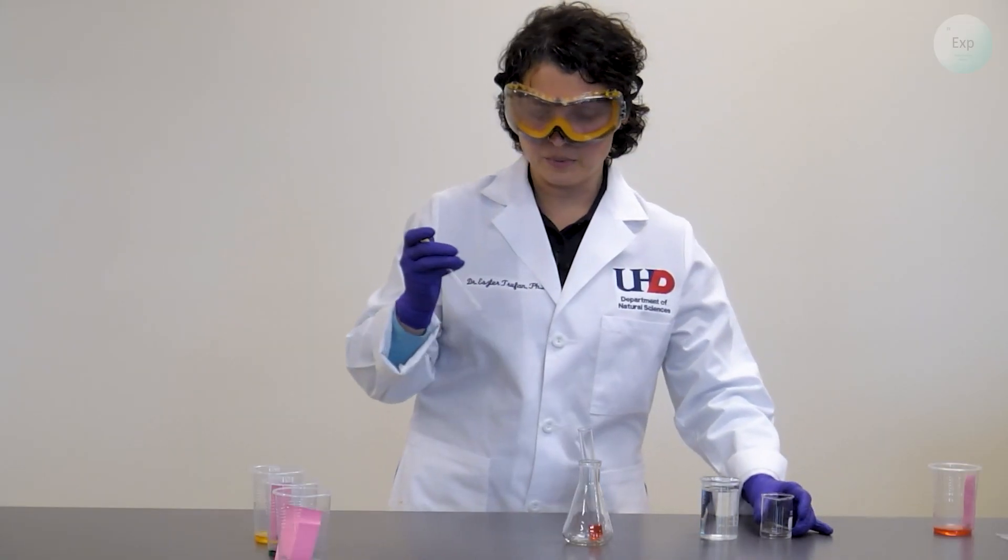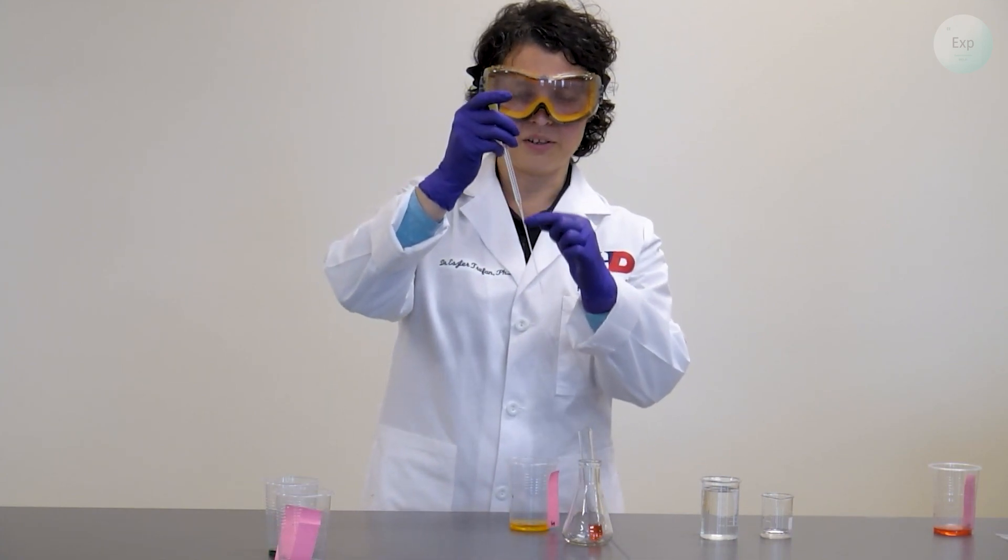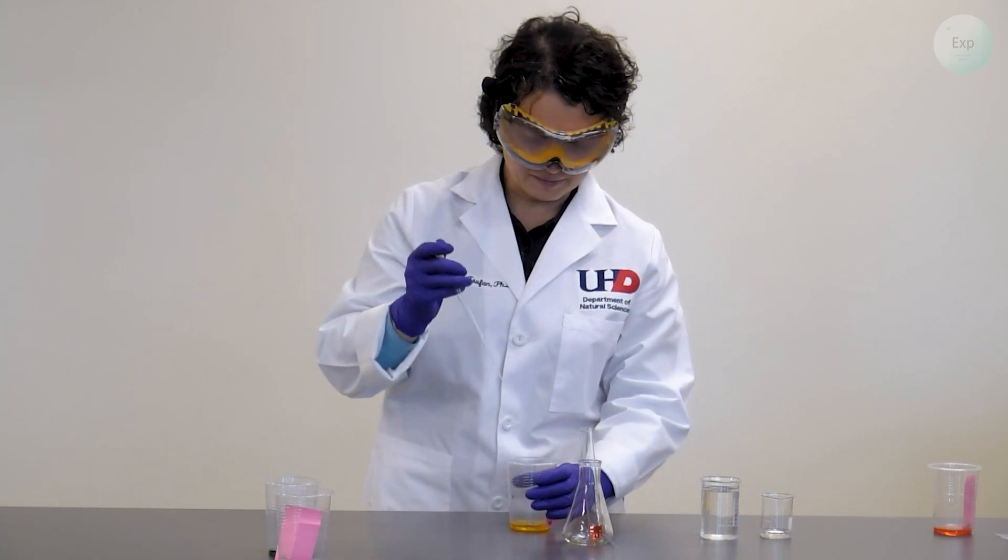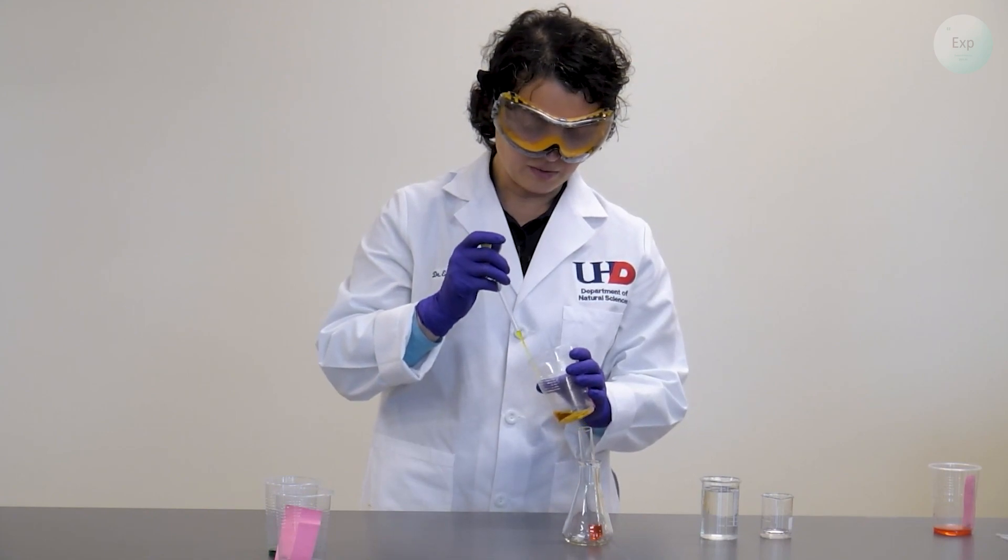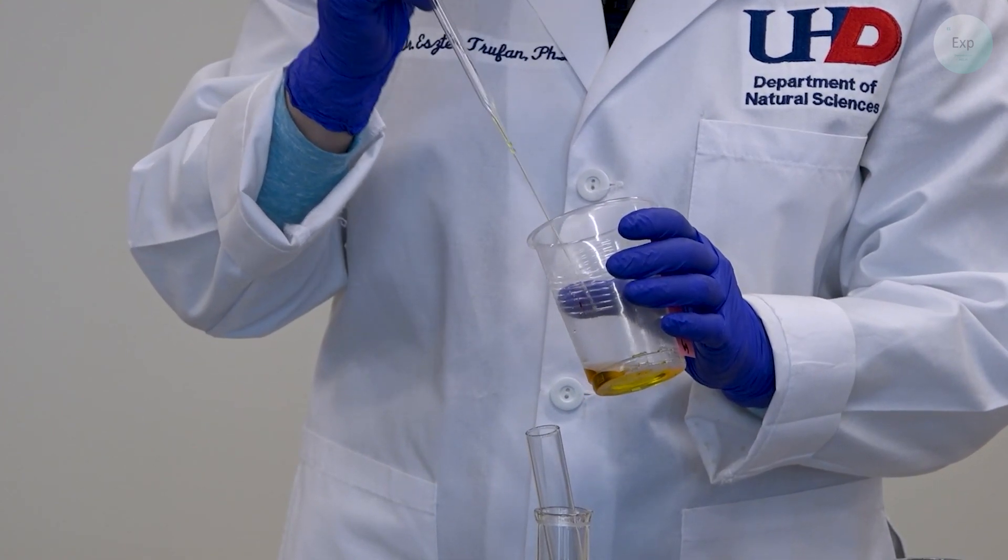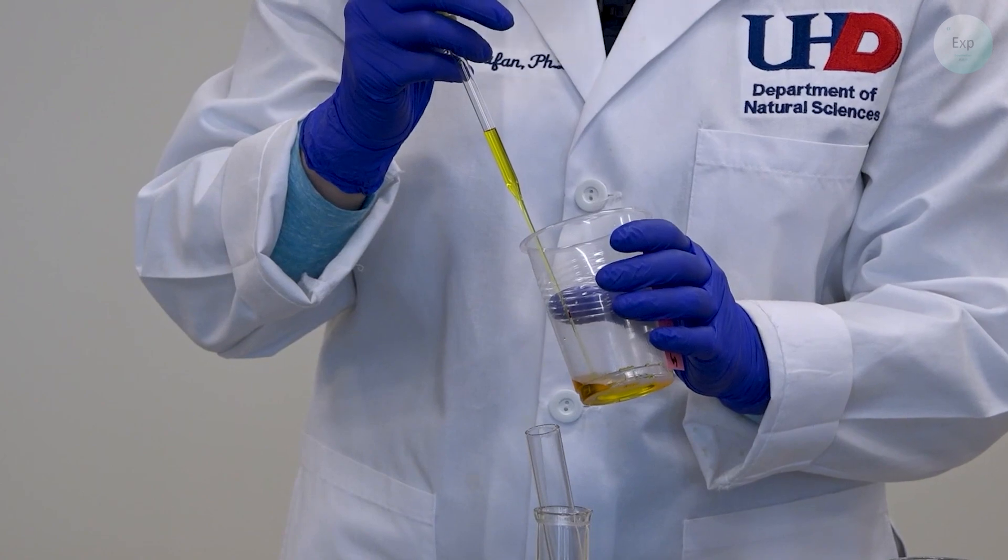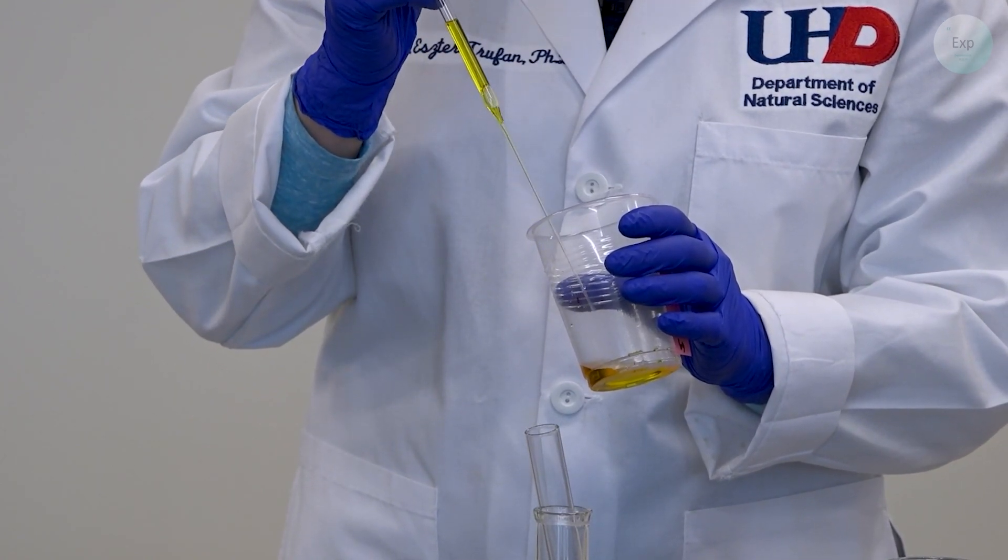Just like we did with the previous transfers, it has a couple little droplets of water. We are going to start pulling up some of the yellow solution, squeeze it back in and we will do this once or twice before we are ready to begin the transfer and the layering.